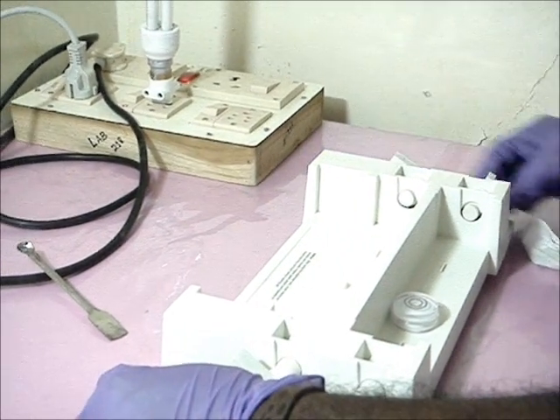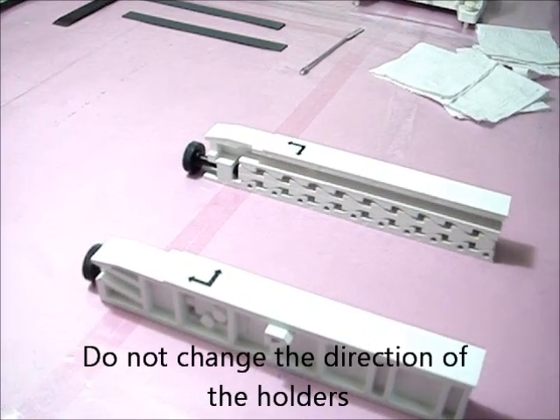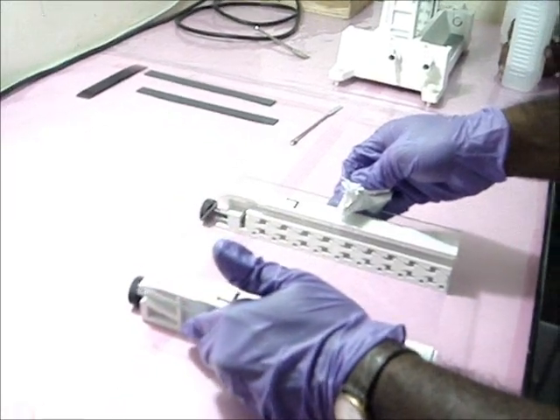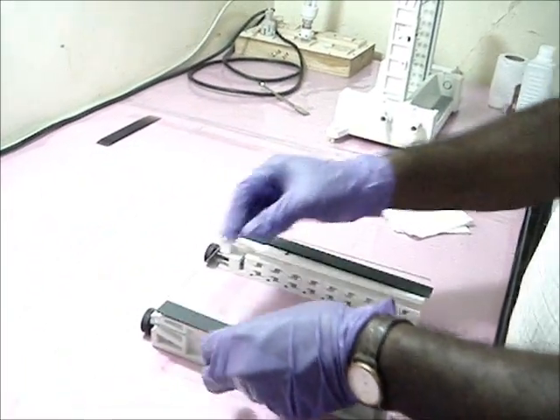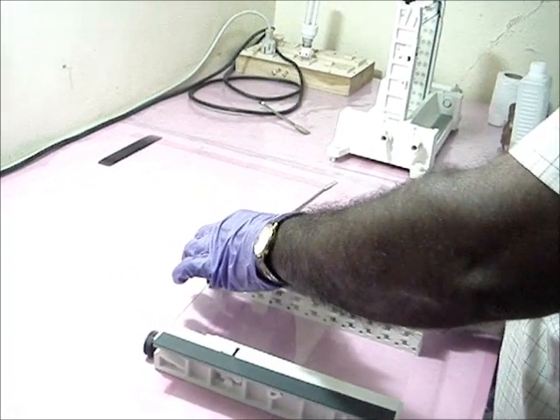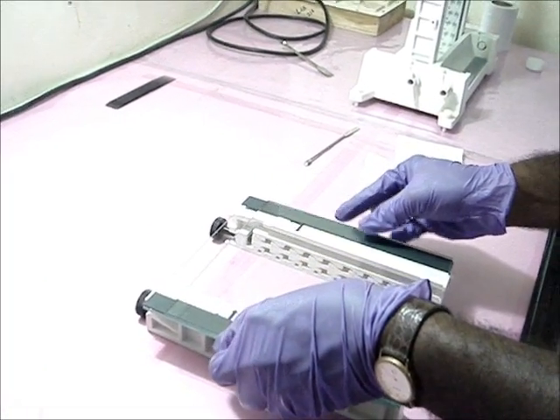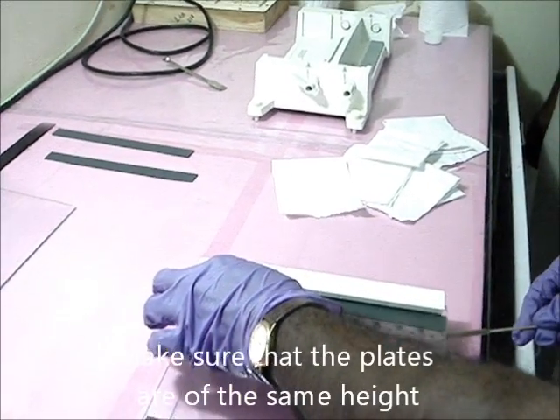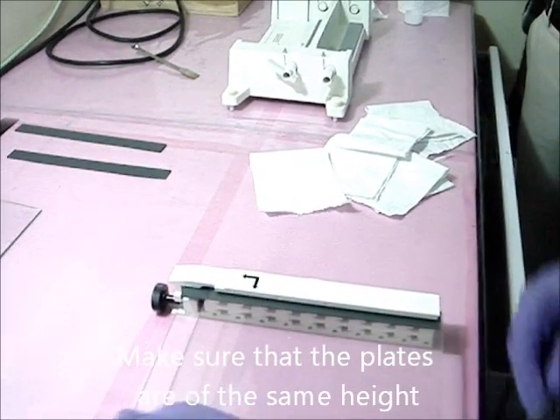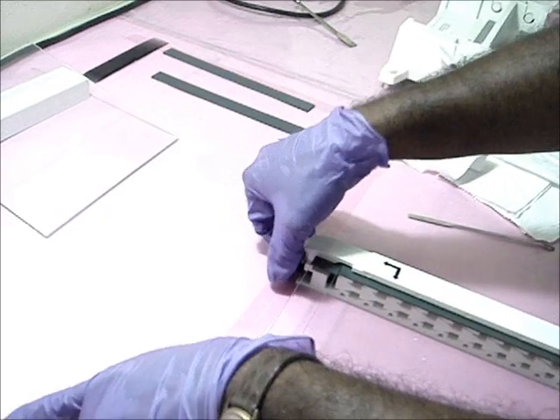Step 4: Second Dimension. Level the apparatus. Place the holders according to the direction mentioned on them. First place the taller plate, then wipe and place the strips. Finally place the shorter glass plate. Fix the plates onto the holders and tighten the screws of the holders.